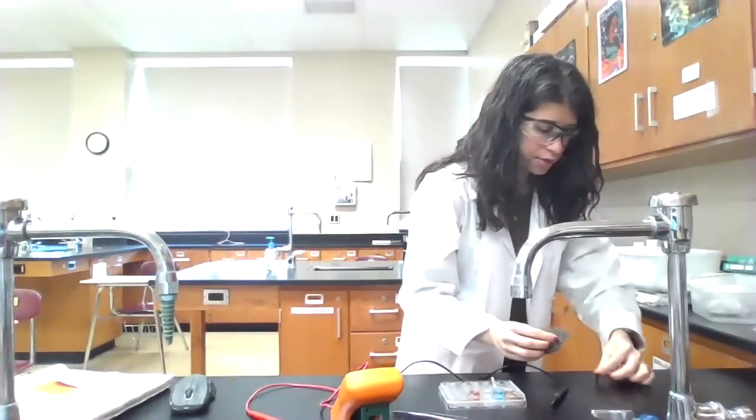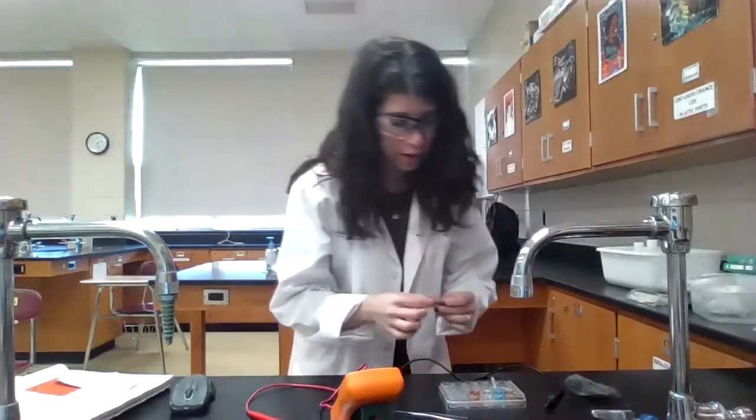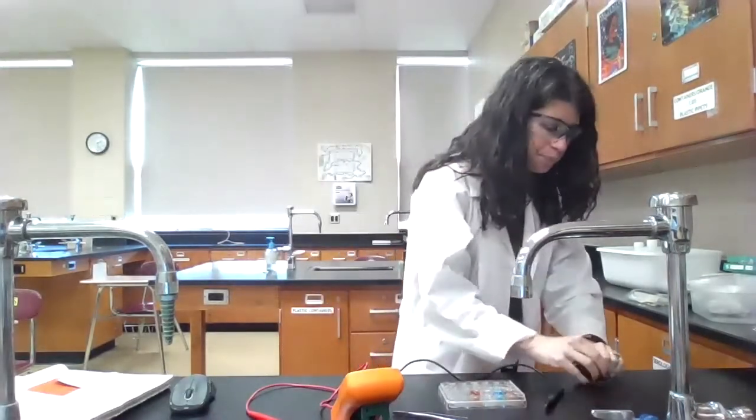And again, I'll clean off any potential oxidation. Okay, and so my silver well is right next to it. Now I'm also going to clean off the zinc one as well, because even just that little bit that the cell was operating at is enough that it could have potentially oxidized.